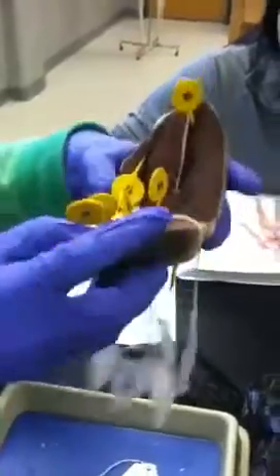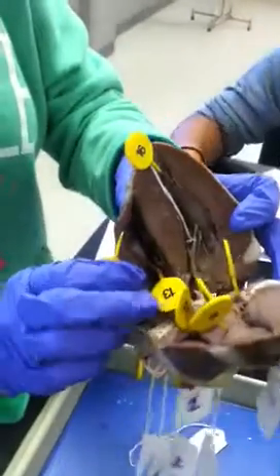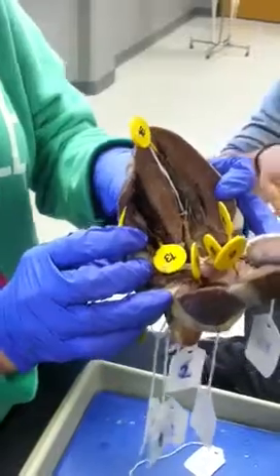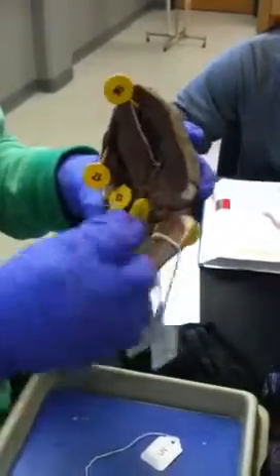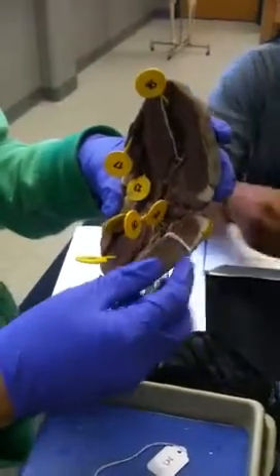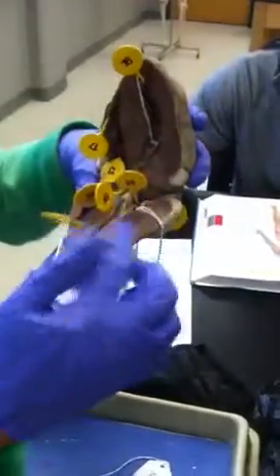And then number 13 is the pulmonary semilunar valve, which guards the base of the large vessel where the pulmonary trunk enters into the heart. It guards the actual entrance at the base of it. And then 14 is the bicuspid valve, which is also known as the mitral valve. That's on the left side of the heart, and it has 2 flaps rather than 3. That's why it's called bicuspid.